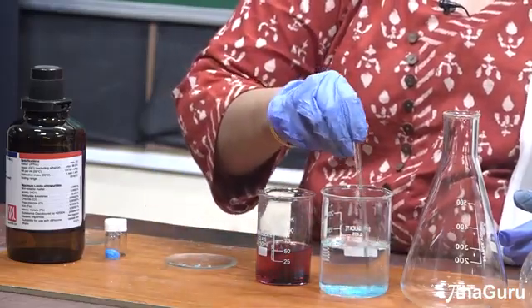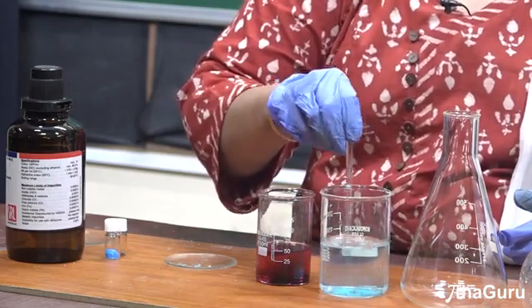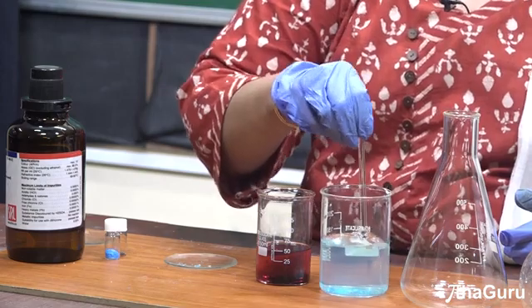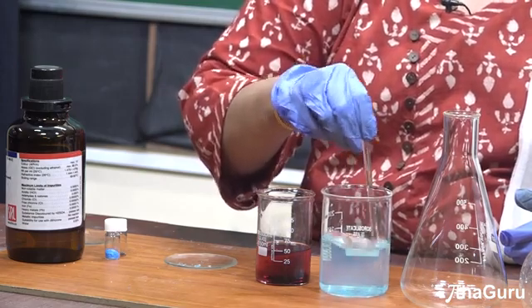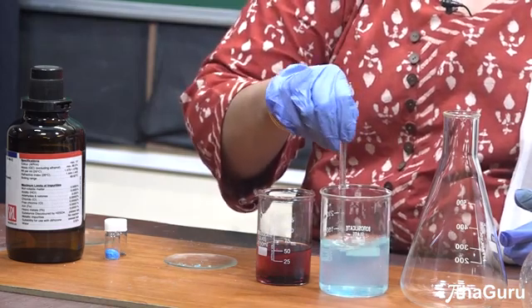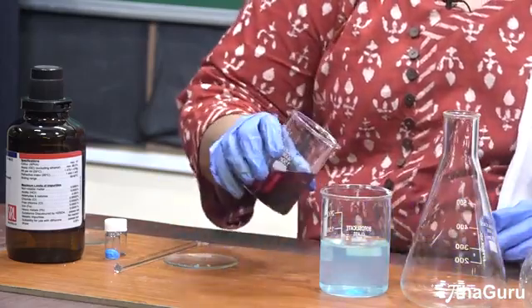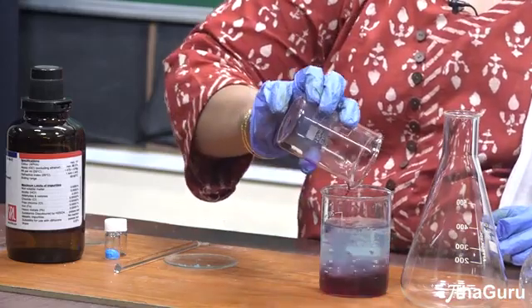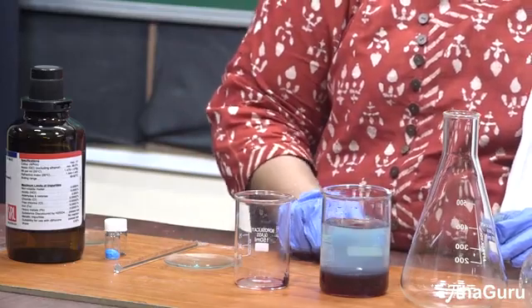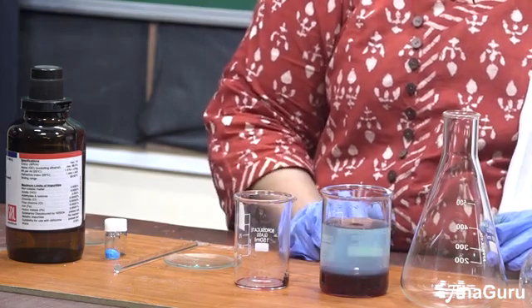We know the concept: like dissolves like. Polar compounds will be soluble in polar solvents and non-polar compounds will be soluble in non-polar solvents. This experiment is just to show the difference in color. You can see copper sulfate is getting dissolved in water. Now suppose I mix these two — you can see the two layers getting separated out. The top layer is copper sulfate and water, and the bottom layer is iodine in chloroform.